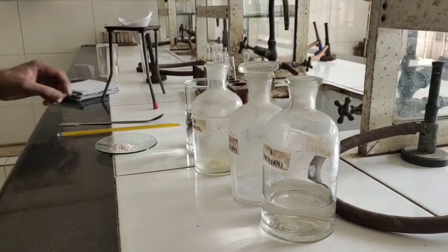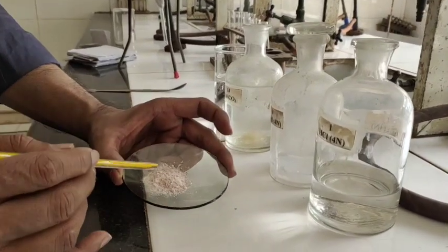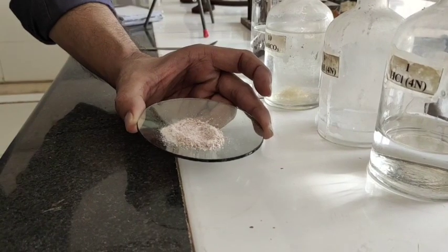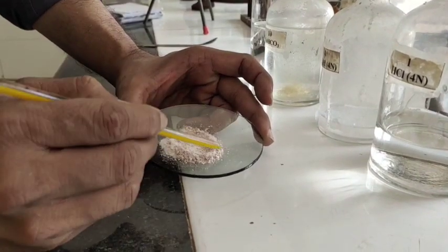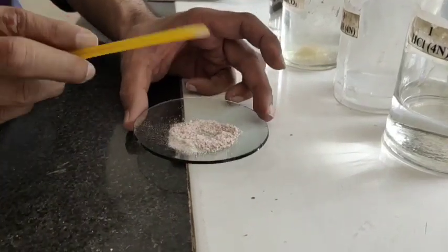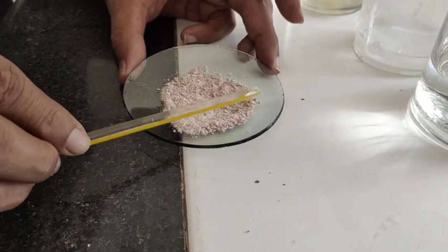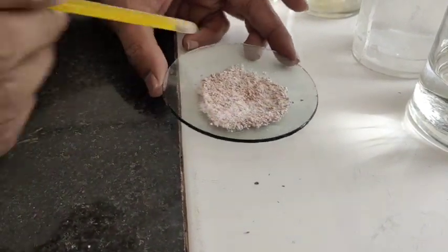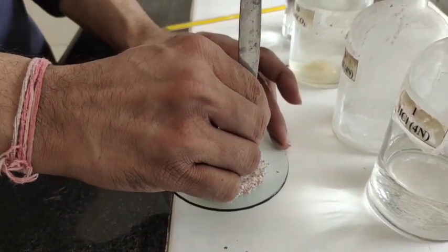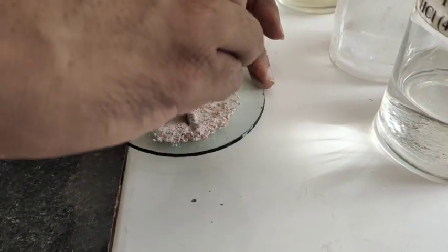Welcome back students. This is our binary mixture. This binary mixture is made up of two organic compounds. What are the possible combinations of the organic compounds present in this mixture? I have discussed this in the first video. For my convenience, I divide the given binary organic mixture into four groups.